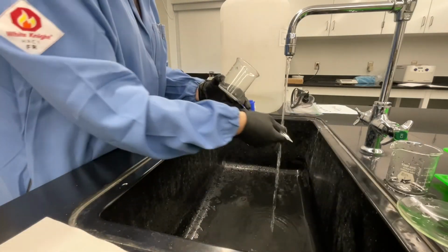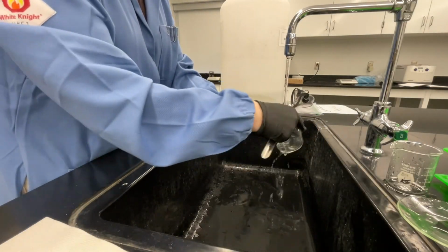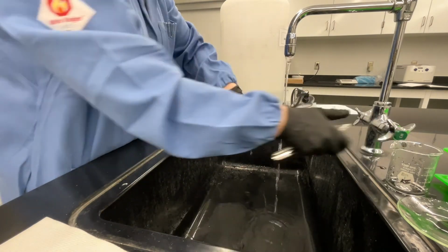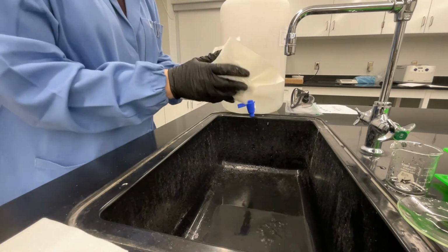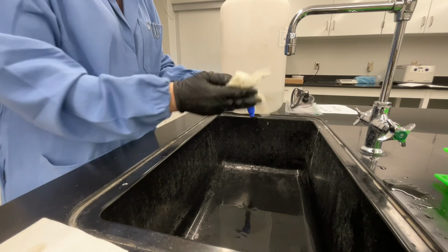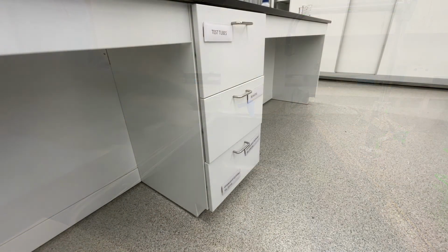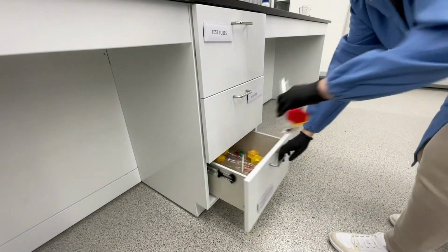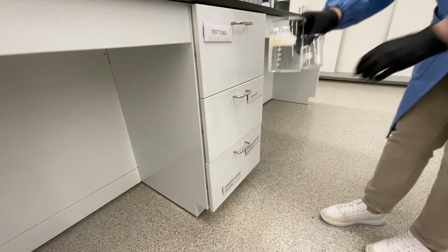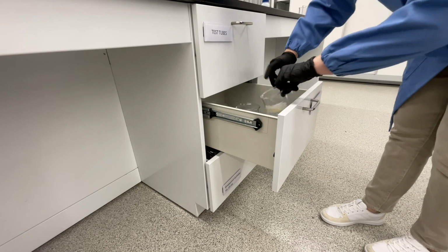Lastly, make sure you thoroughly wash all of your glassware. You can use tap water to rinse all of the glassware we used in this experiment. After you've rinsed it thoroughly, use a paper towel to lightly dry it off. It doesn't need to be fully dry, just not dripping wet. Then you can return your glassware to the drawer where you found it. You shouldn't put any glassware on the drying rack, but instead return it back to where you found it. At this point, you are completed with the experiment.